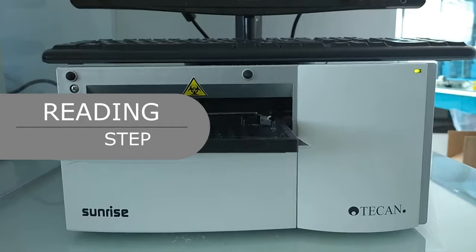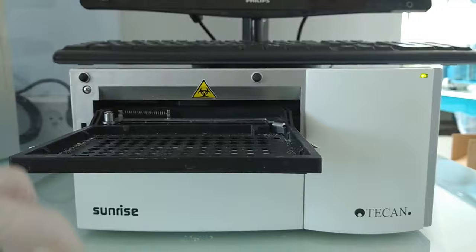Read and record the OD at 450 nm. The plate must be read within 30 minutes after adding the stop solution.